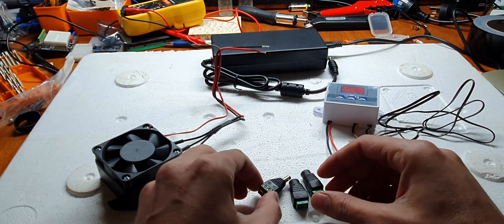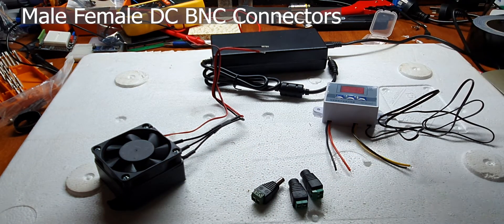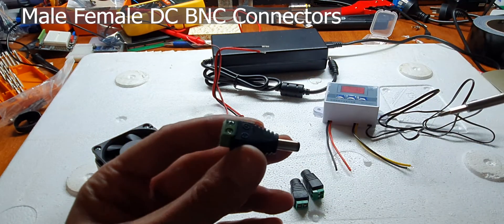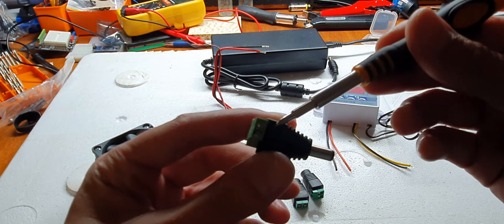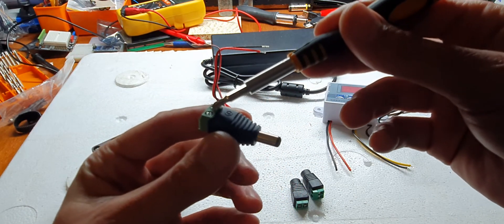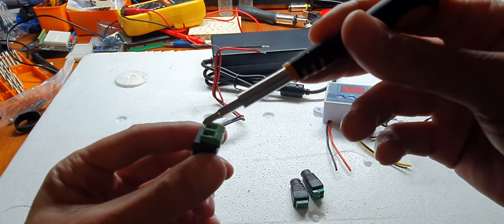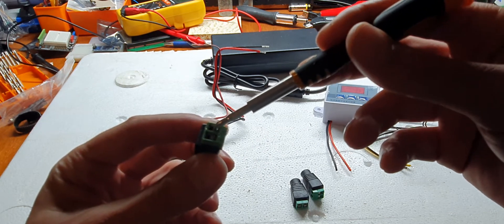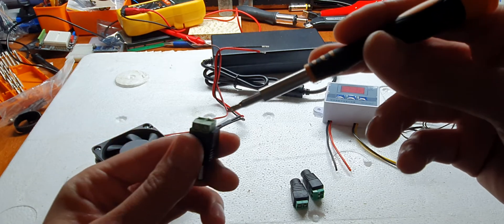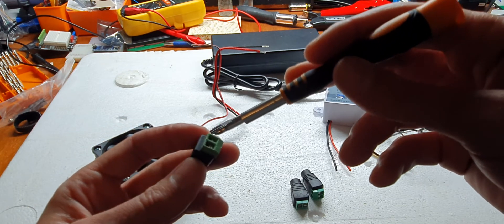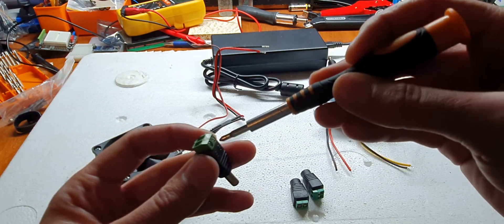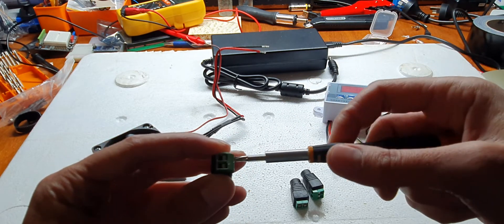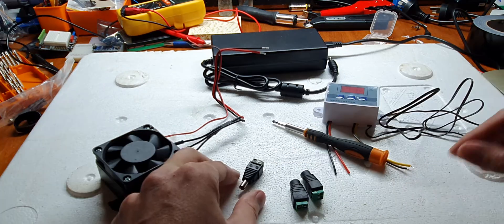You're going to need a screwdriver but it's pretty straightforward. You have these screws that will tighten up or loosen a little metal jaw in the back of the connector where your wires are going to go. Basically all you have to do is just match up your wire with the right symbol on the back of the connector, loosen the screw, put the wire in and tighten the screw, and that's it, you're basically done.